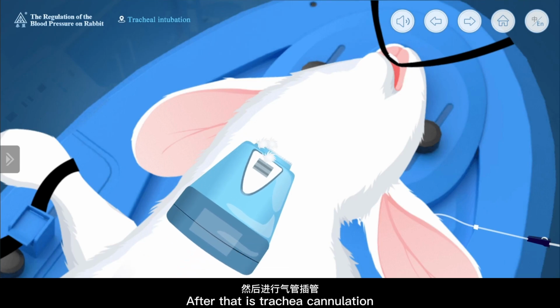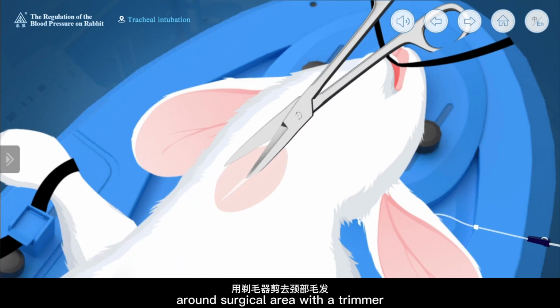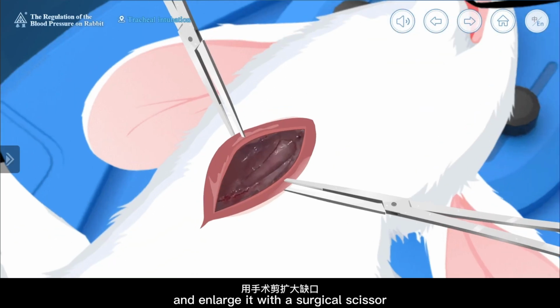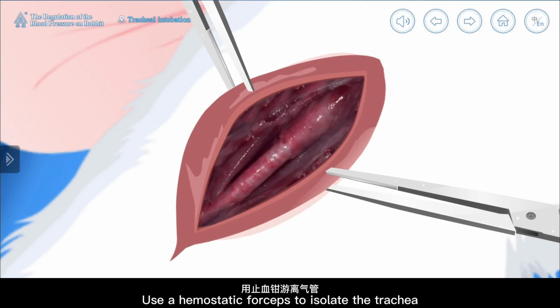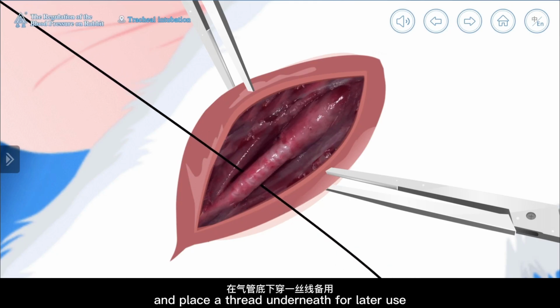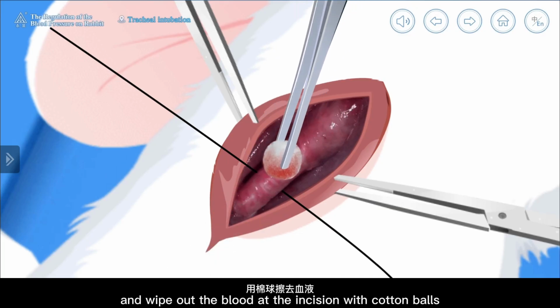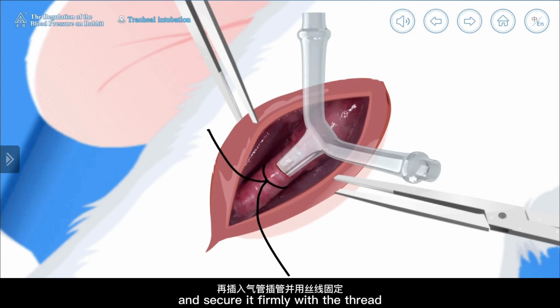After that is trachea cannulation. Remove its neck fur around the surgical area with a trimmer, followed by making a neck incision with a scalpel and enlarging it with surgical scissors. Use a hemostatic forceps to isolate the trachea and place a thread underneath for later use. Make a T-shaped incision on the trachea with surgical scissors and wipe out the blood at the incision with cotton balls. Insert a tracheal cannula and secure it firmly with a thread.